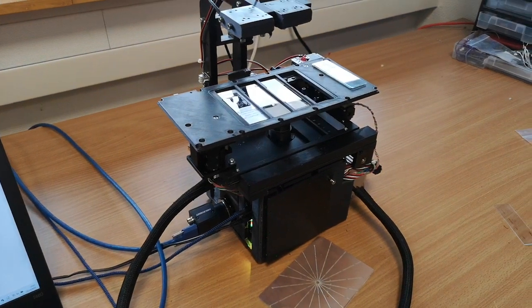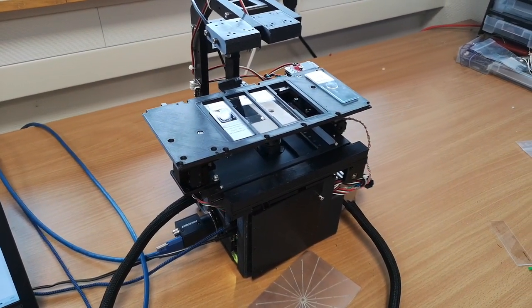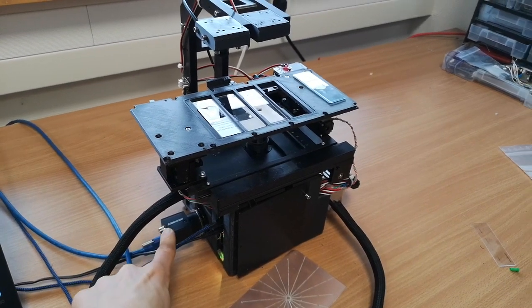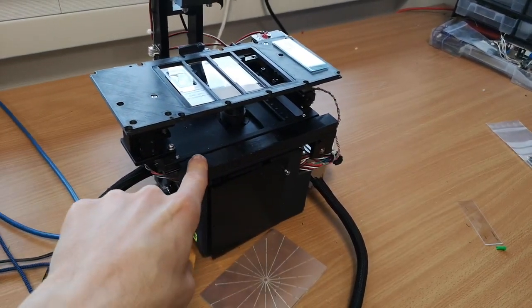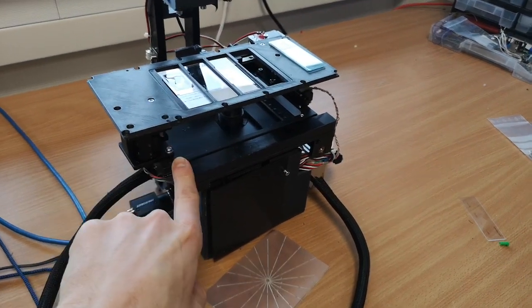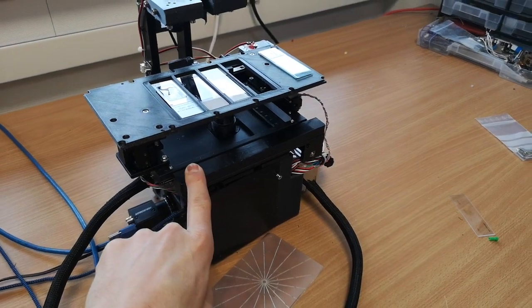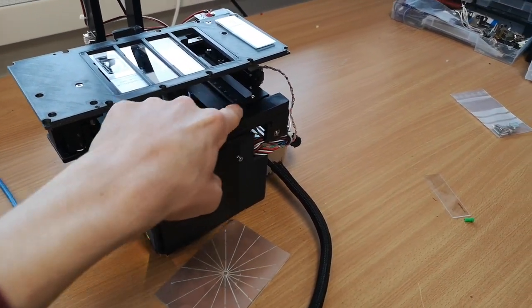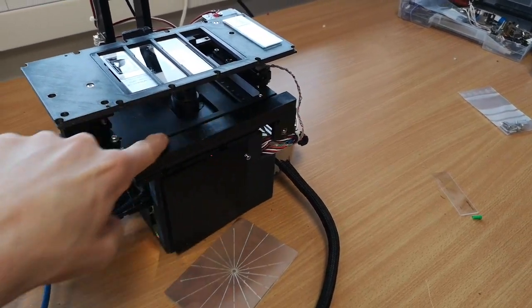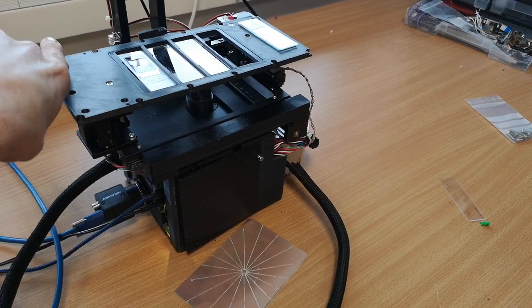So what we are showing today is how the different axes of the microscope are organized. We have the camera on the left hand side. The stage here is moving in X and Y and Z, and then you have the illumination, and what we are making sure is that the X-axis is moving in that direction in the negative, and here in the positive, and here in that direction is positive, and there it's negative.